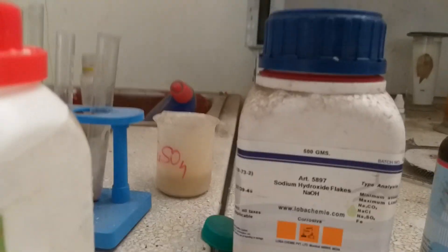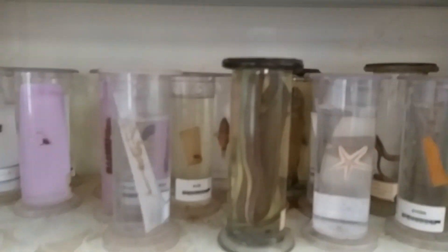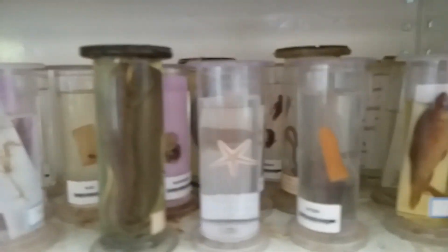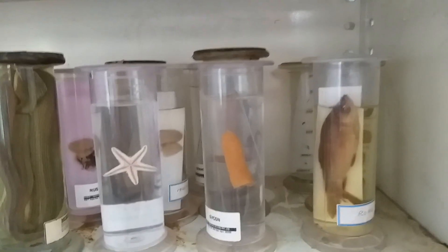These are various chemicals: sodium hydroxide (NaOH), ammonium chloride, methyl orange, phenolphthalein solution, and sodium carbonate. In this way the different equipment and specimens can be seen.